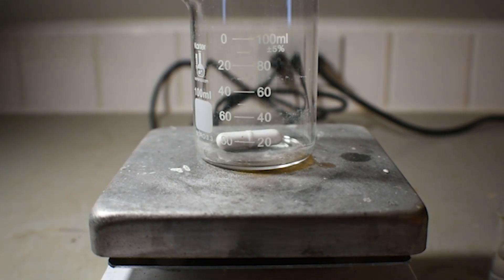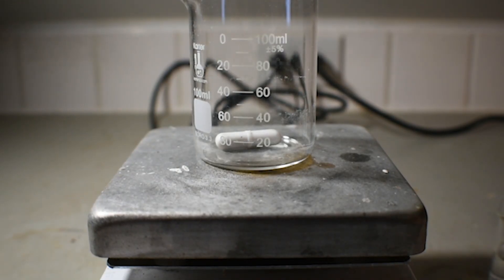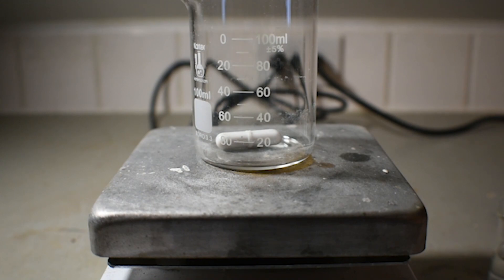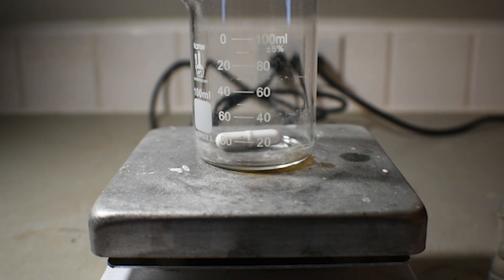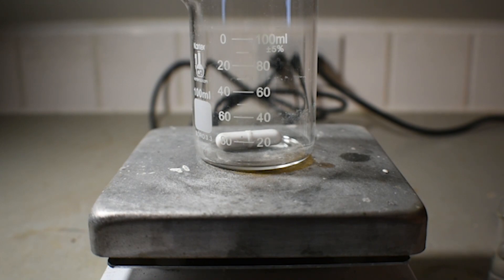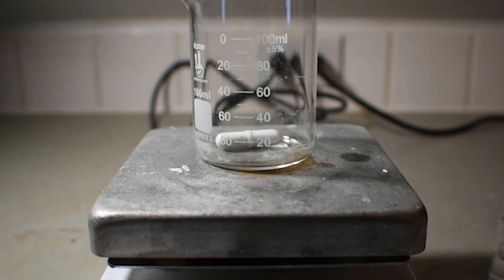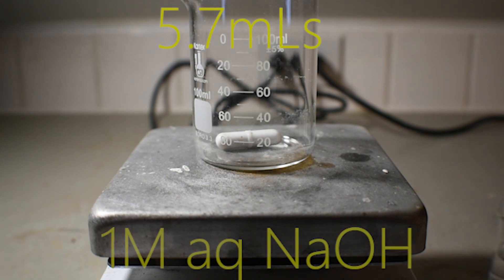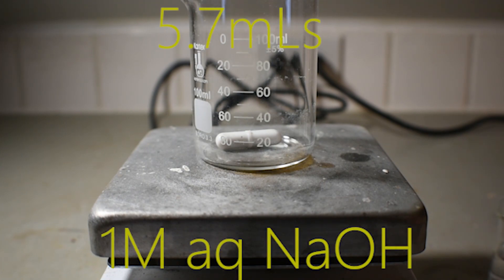Now, this 0.75 grams of sodium borohydride are going to be dissolved in 5.7 milliliters of a 1 molar sodium hydroxide solution.